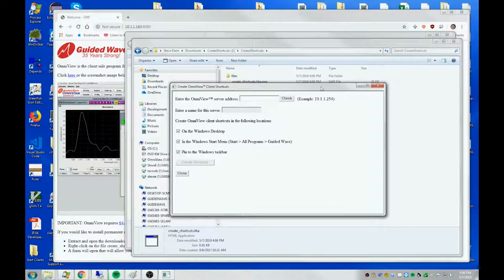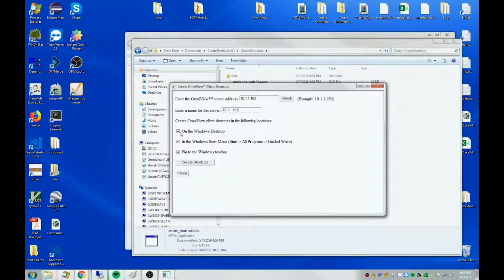It brings up this small form. All you need to do is fill in the IP address of the server. Don't need to provide the port this time though. Click this button. You can change the name here if you wish, and then select where you want these shortcuts to appear on your computer. On the desktop, under the Windows Start menu, or on your taskbar, which is down here. And I'm going to go ahead and create shortcuts in all three of those locations.